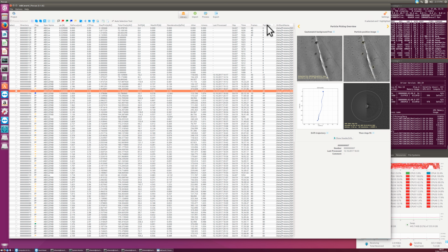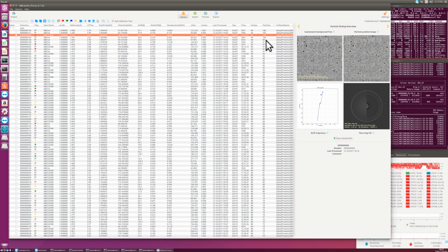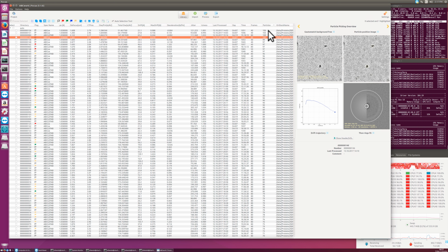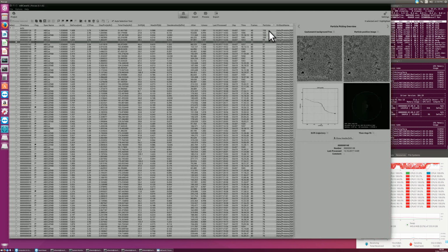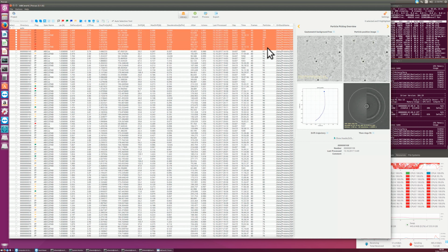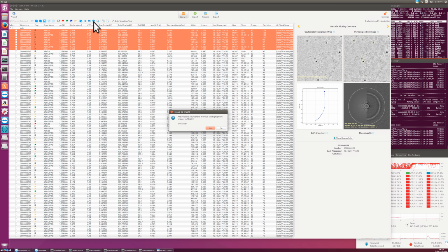Yeah, and the ones that have too many particles, that may also be a problem, so let me sort this by too many particles. The top of the list. Yeah, here this is something else. These are not the particles we were looking for, and then it found far too many, or it's overcrowded anyway, we couldn't use it. So here again you could sort by particles and take all the images that have too many particles here and move them to the trash. And so on.